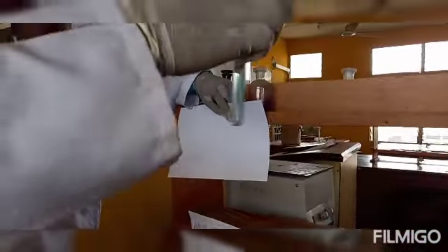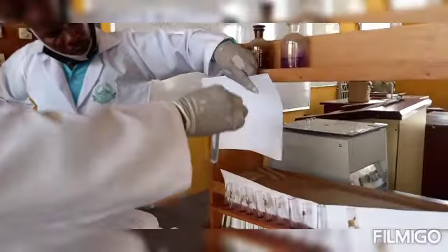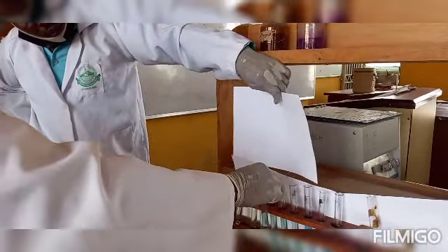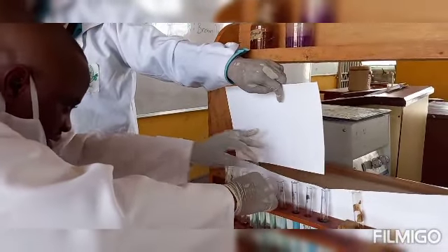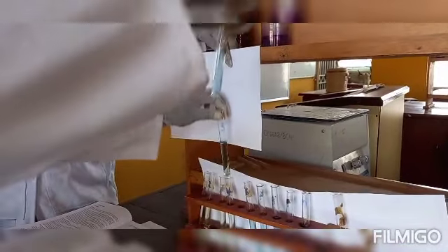That of saliva, as you can see, we also match. You can even see that this one doesn't fall in the range of the yellowish color. It's tending towards bluish color. So we begin to pick it from here. It's more bluish than this.